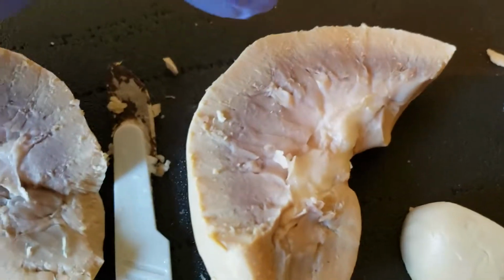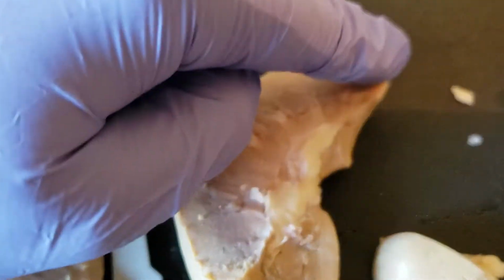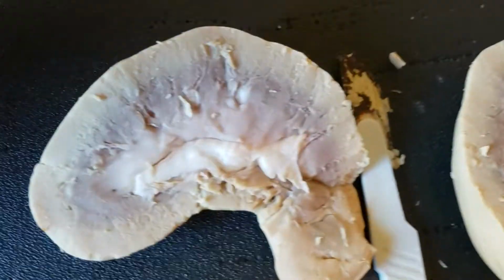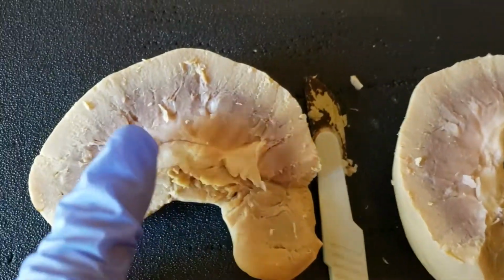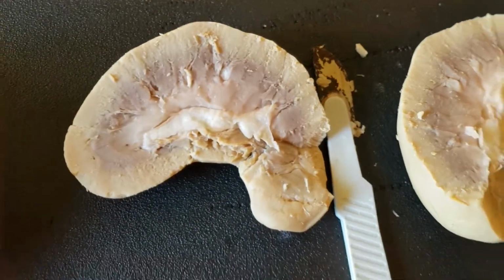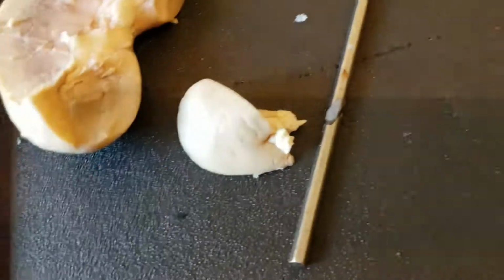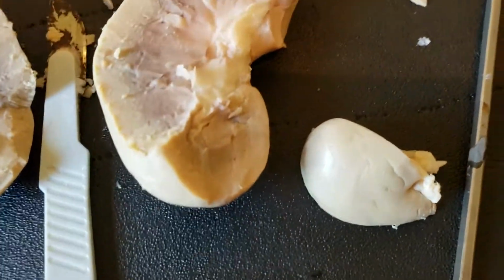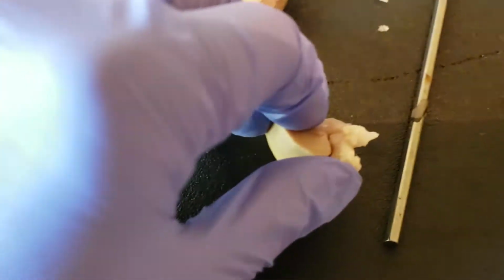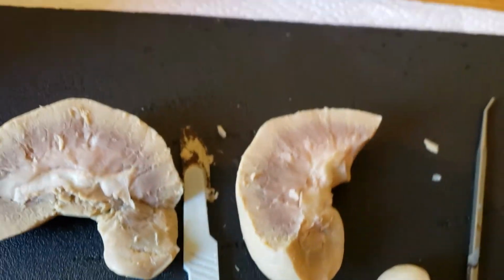So renal cortex. That is this part right here, the outer layer of the kidney, also over here. Then you have the renal medulla, which is the inside-y part. Follow that up, you got the renal pyramids. The thing about this dissection is obviously more like a trisection, am I right? And I also think this is either the renal vein or artery. It's hard when they're not dyed, like they said in the dissection thing.